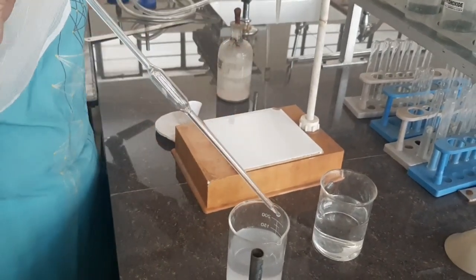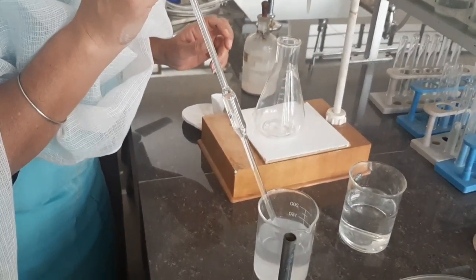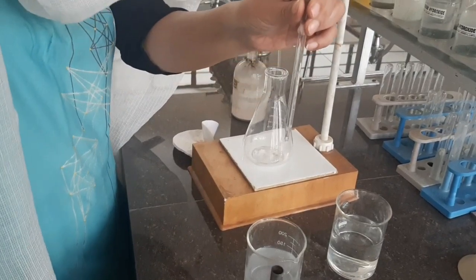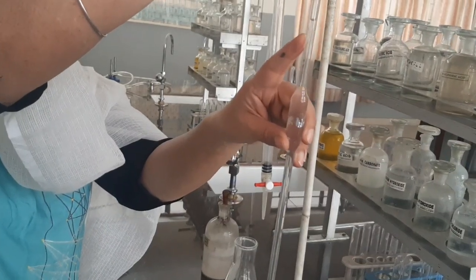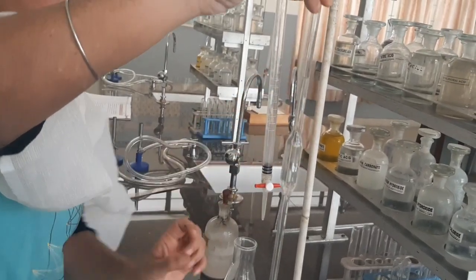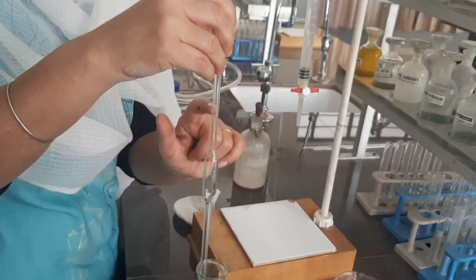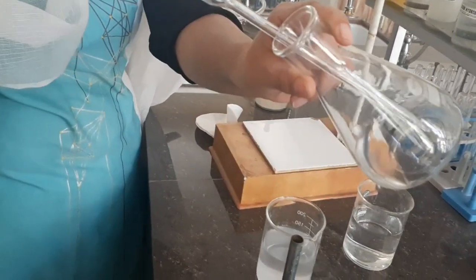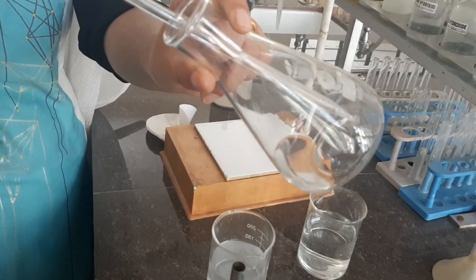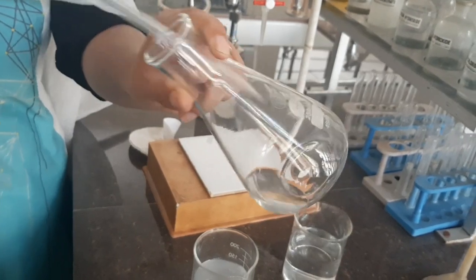Now suck in 10 ml more of the sodium hydroxide solution. When the lower meniscus reaches the mark, transfer this liquid into the titration flask. Again, you can see a few drops remain at the bottom of the pipette — do not blow these out. Simply touch the tip once or twice at the bottom of the container.